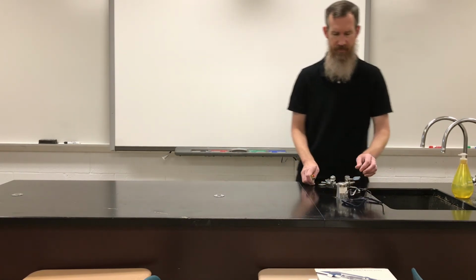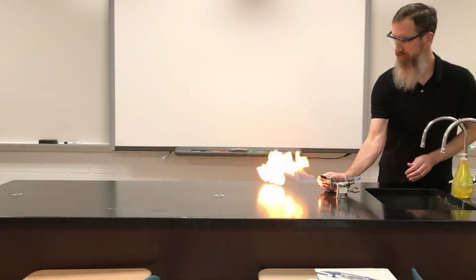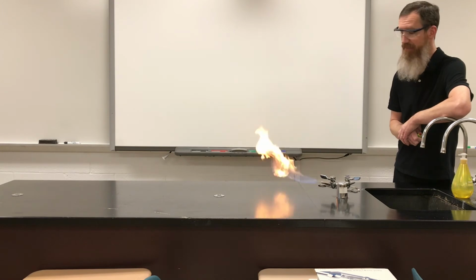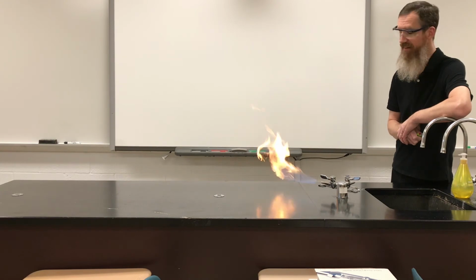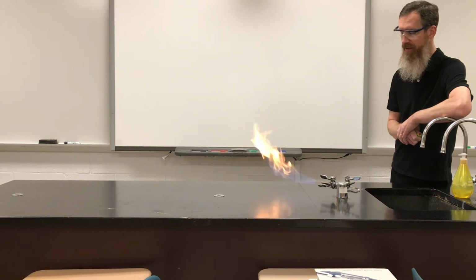So let's turn on the gas, turn on my lighter, and that's a reaction, that burning. It's throwing off a lot of heat, you see a lot of light, the chemical change is very evident. What's not evident is the products. So I'm just going to tell you what the products are.